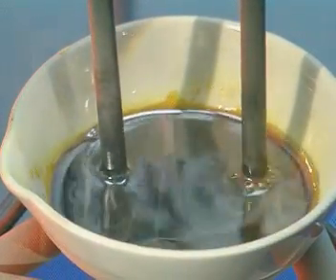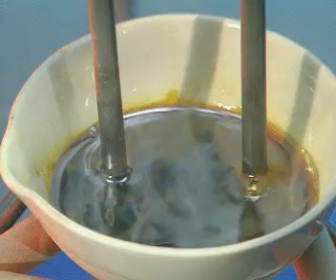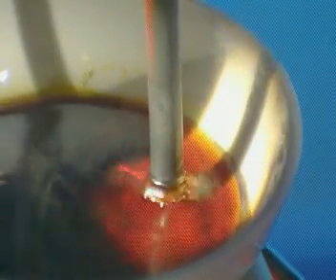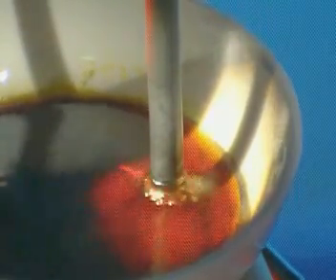On the left, at the negative electrode, nothing appears to be happening. But at the positive, bubbles mean a gas is being produced.